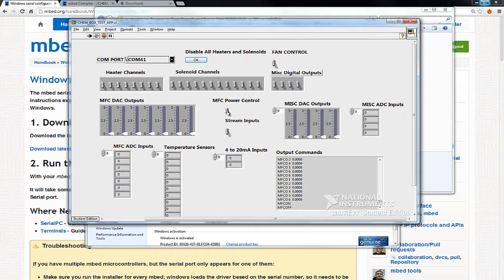The MFC power controls a relay. I'm sitting by a box so I can hear the relay going off and on. You can turn the fans. I can see the fans going off and on. And this is the string that you can see down here that gets sent out over that serial port.